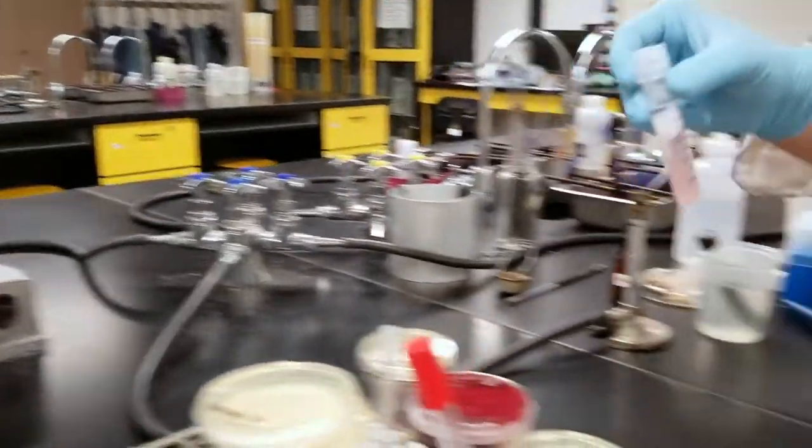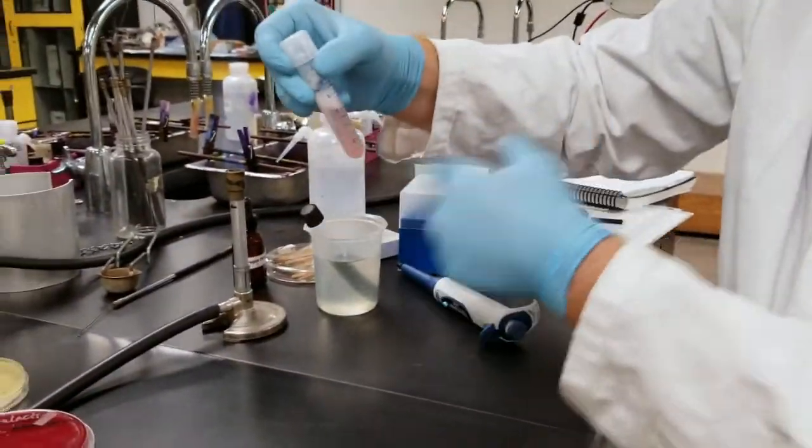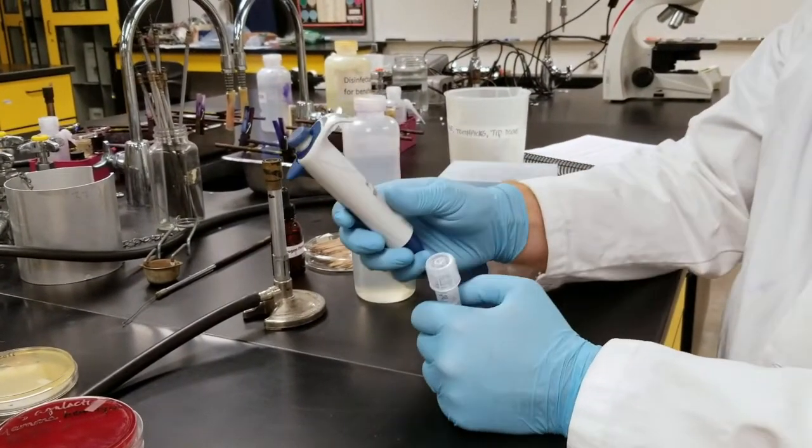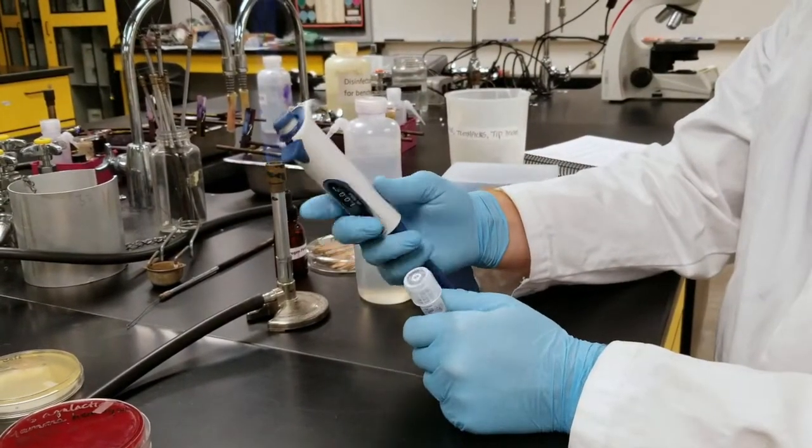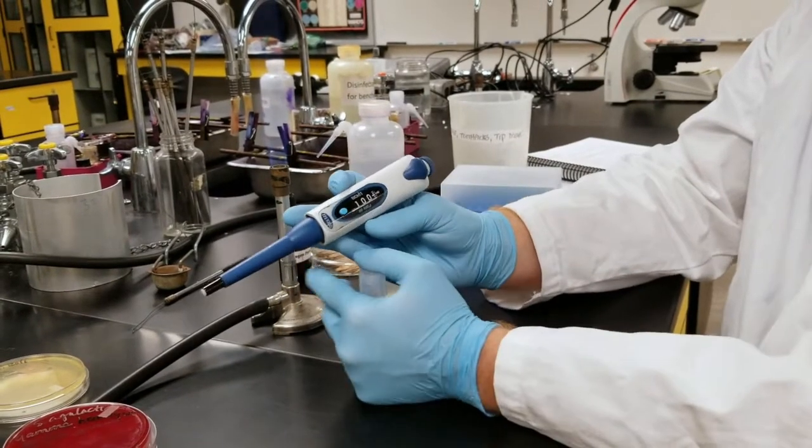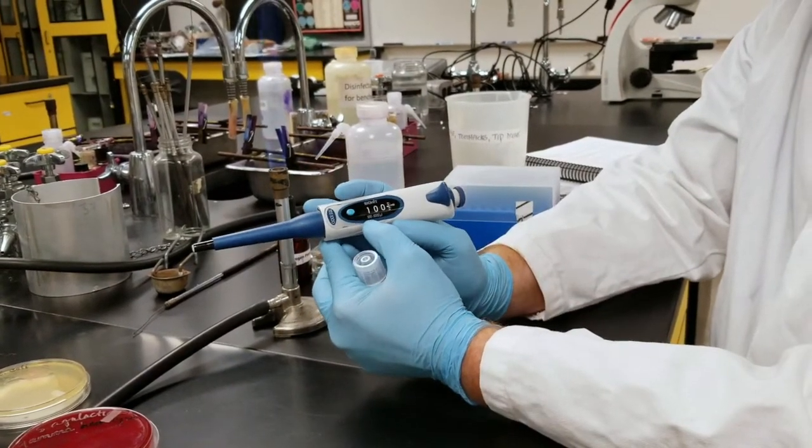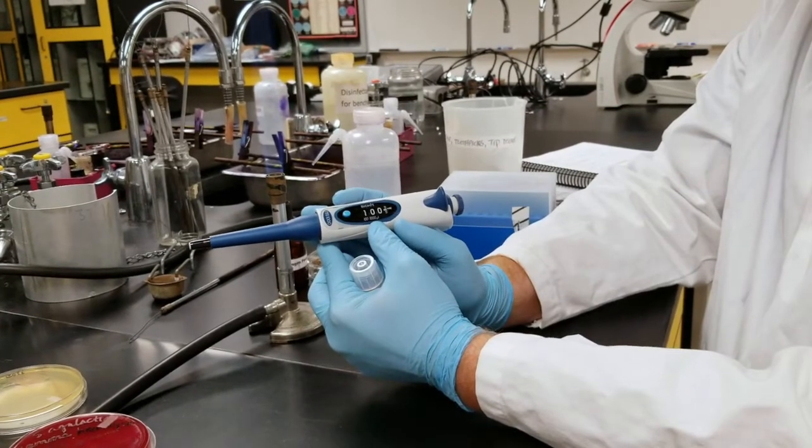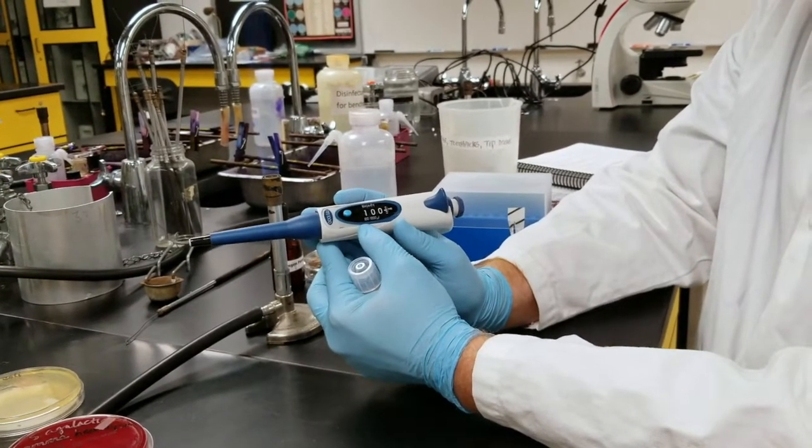Another thing I could do is just hit it with my fingers, like so. Now I'm going to use my pipette. This is different than the automatic pipette that we used before. This pipette will pipette 100 to 1000 microliters, so 0.1 mils to 1 mil.